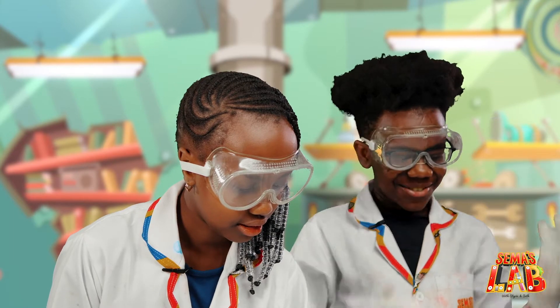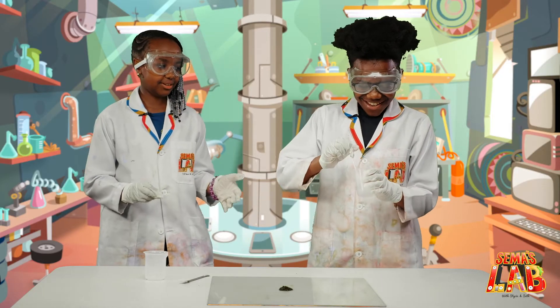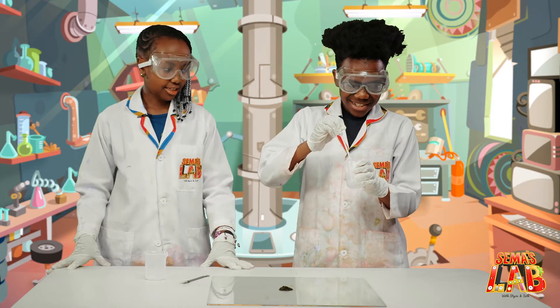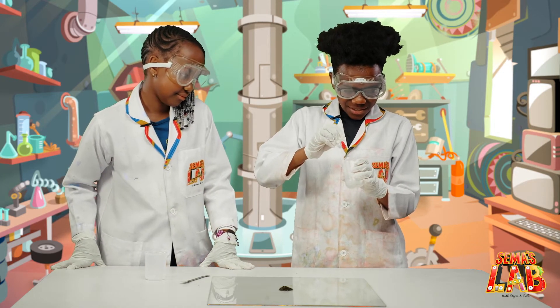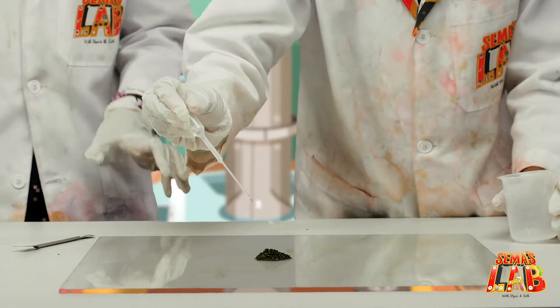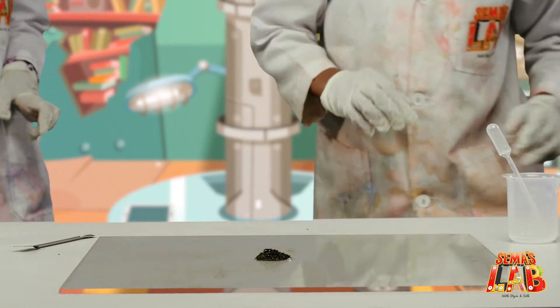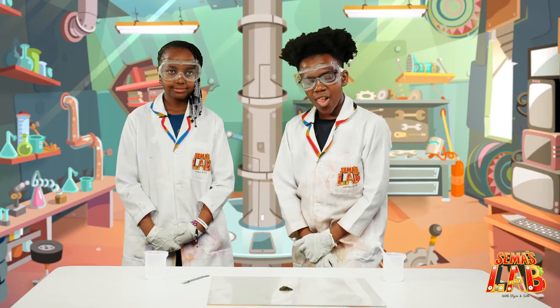She already has them on. Now we're going to step back and then he's going to put the glycerin. We're going to use the dropper. As it drops... one, two... then we're going to step back and wait for it.